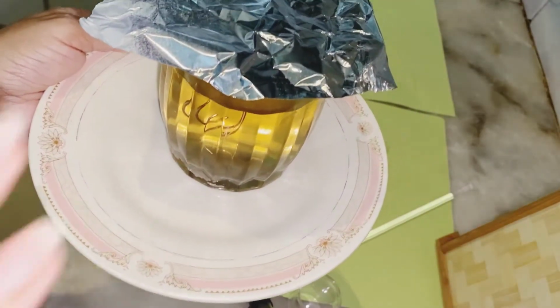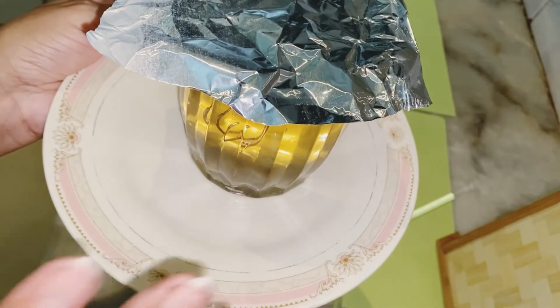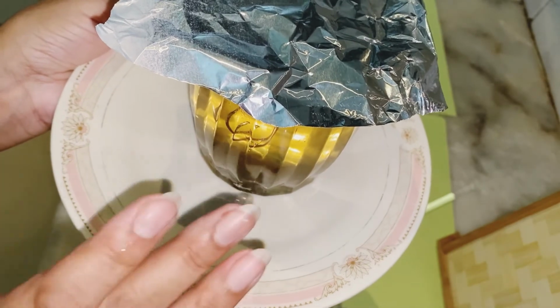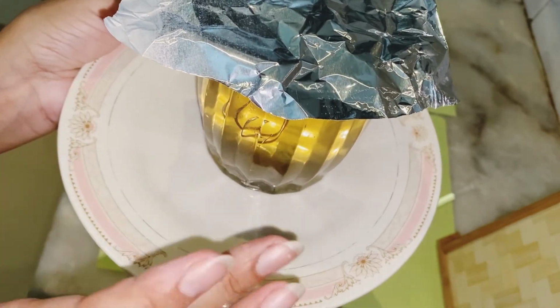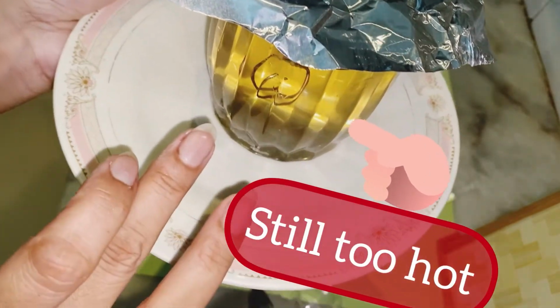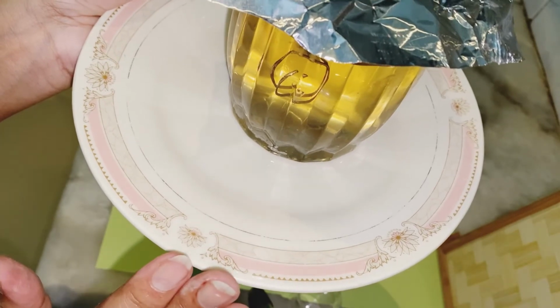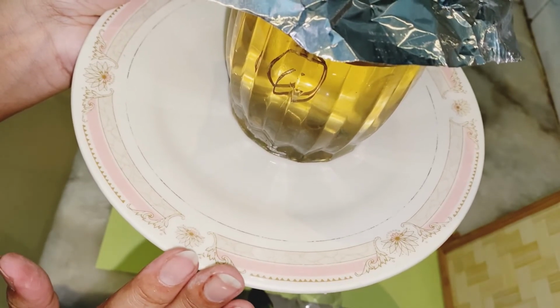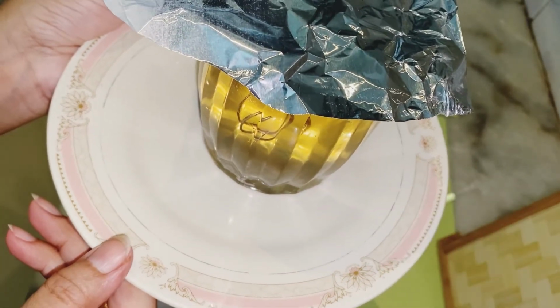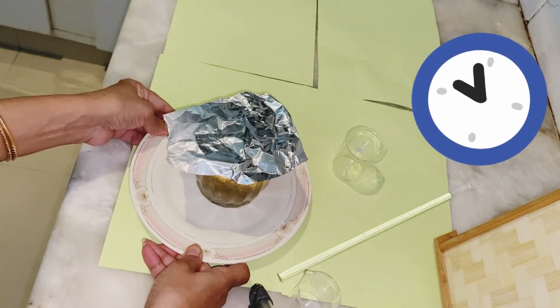Now here you can see it's been covered with this foil. I don't want to stop or block the air. I want to cool it down uniformly with time, and it's now going to be kept for almost 5 days, and then we'll see what happens after 5 days. I will keep it at one side and we'll wait.